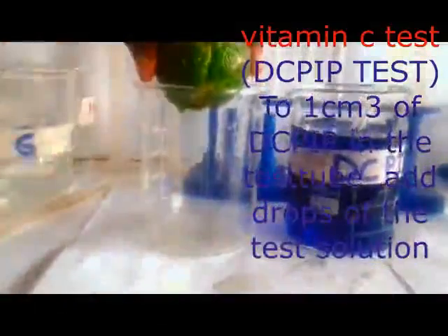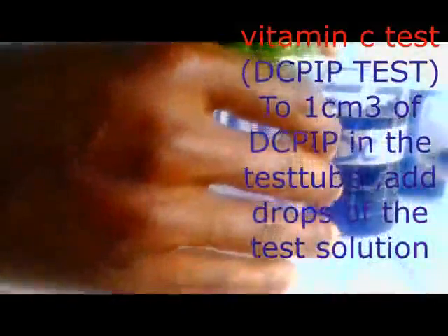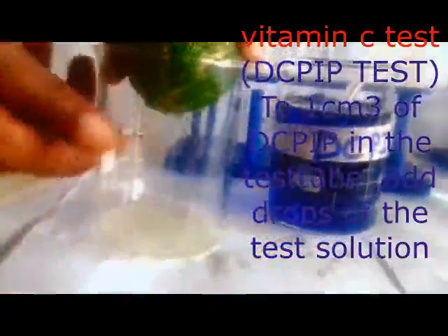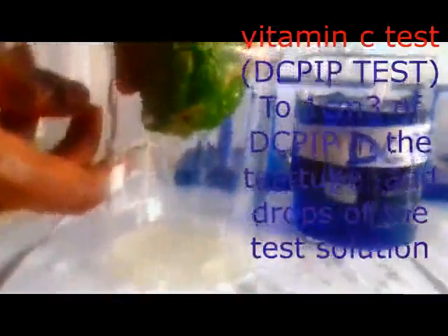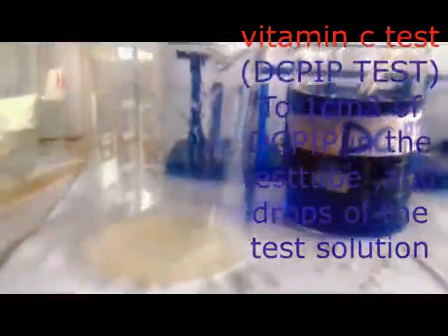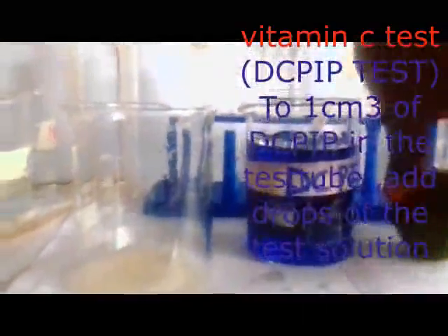So I get my juice. Let me try to squeeze and I get some juice from my lemon. Let me squeeze a bit. There we go. I have got my juice from my lemon fruit.